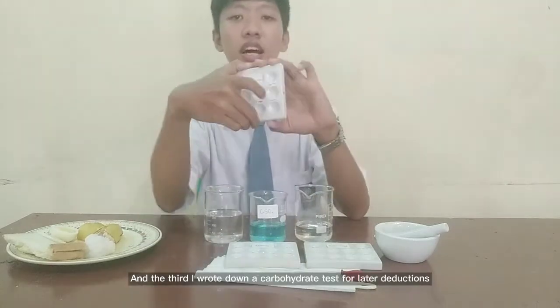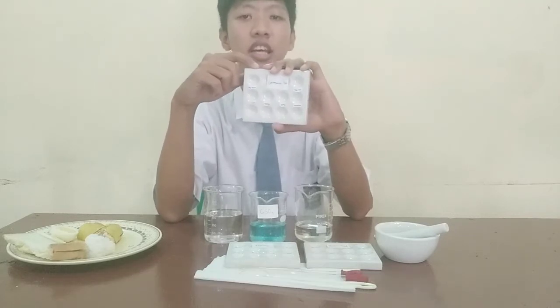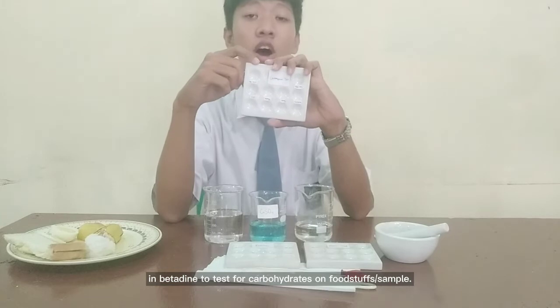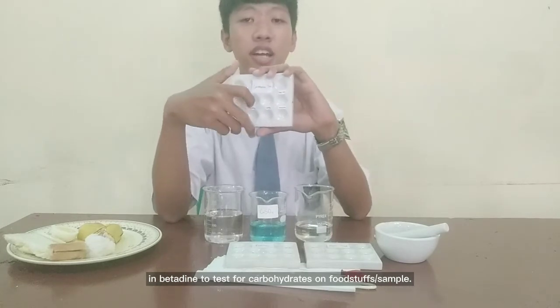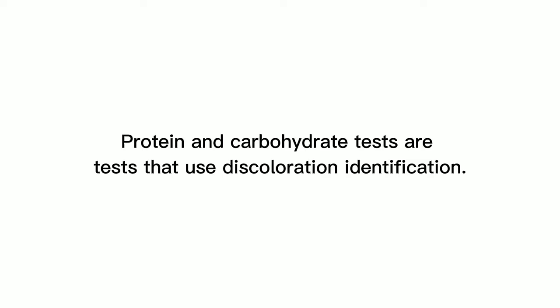The third I wrote down a carbohydrate test for later dripping in betadine to test for carbohydrates on foodstuffs. Protein and carbohydrate tests are tests that use discoloration identification.